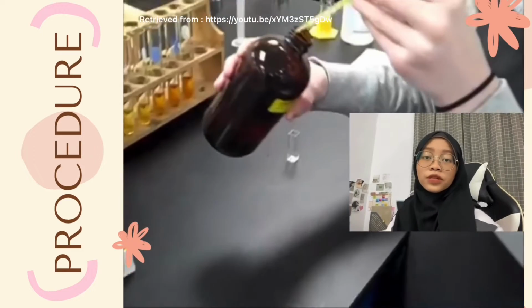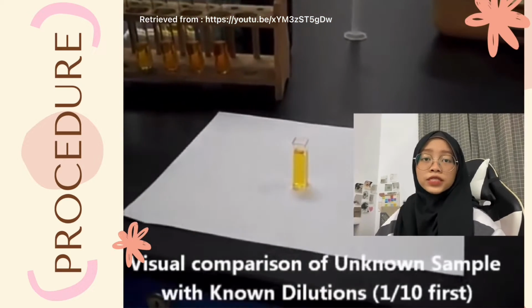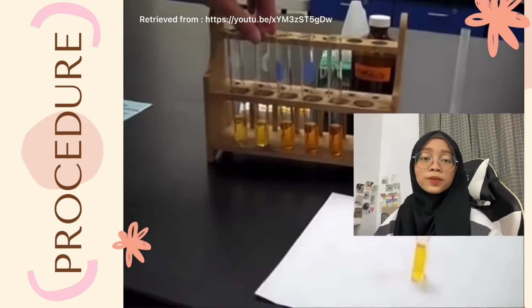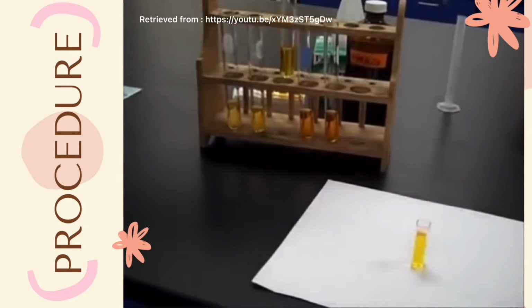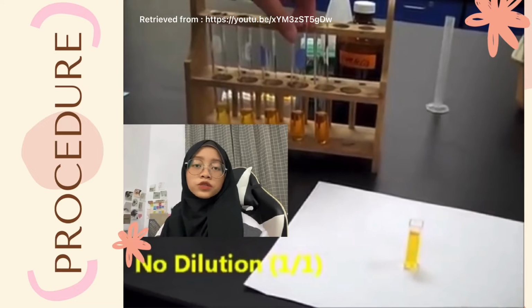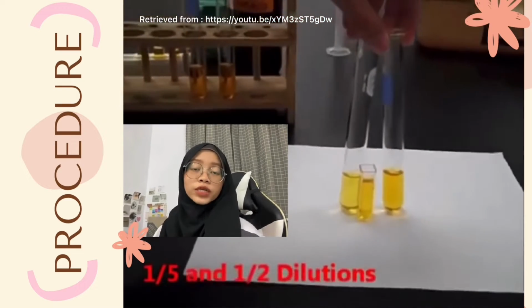The unknown sample of iron trichloride was pipetted into a cuvette until 3/4 of the cuvette was filled. Visual comparison of the unknown sample with the known solutions was made to see which of the samples the unknown solution is most similar to. The unknown sample was seen to have a concentration between the two dilutions, which are 0.08 and 0.2 molar of iron trichloride.